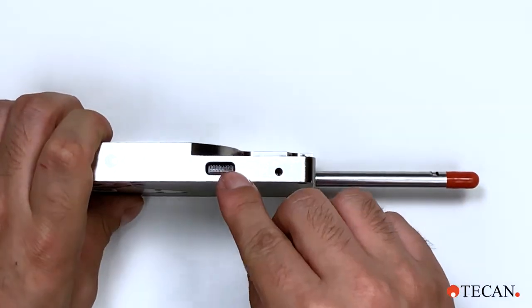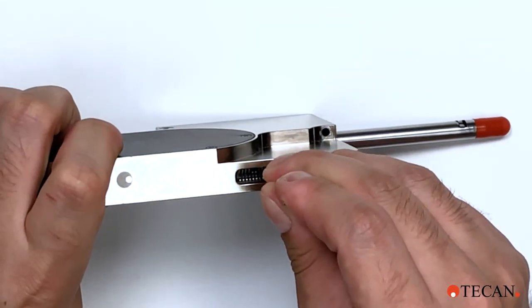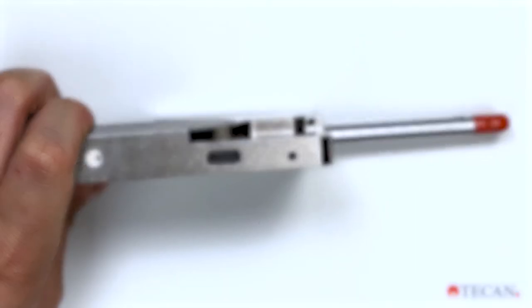Using a small pin or other sharp tool, carefully move dip switch 8 to the down position.